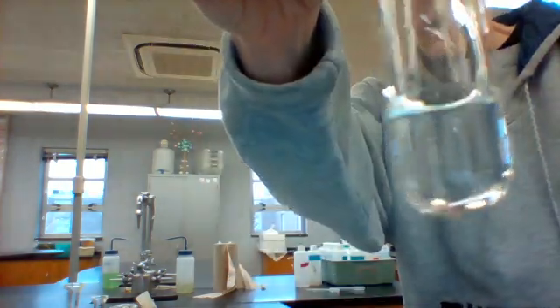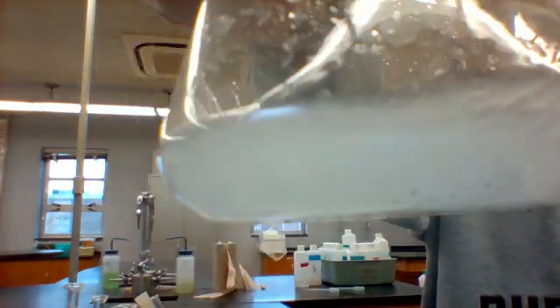So here is our kind of chunky substance. Again, clear liquid here, and we're going to put those together. I don't know if you can see that or not, but it is bubbling quite a bit there. If it bubbles like that, it is definitely forming a gas. I'm going to swirl it like it tells us to, and again, you can still see it's making quite a bit of gas. If that cork had been left on, there's a good chance it would have popped off of the flask. Obviously, even with safety glasses on, that's a little bit dangerous.